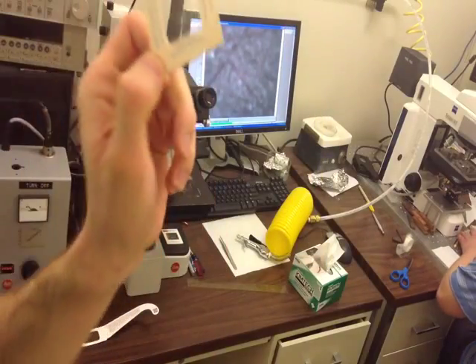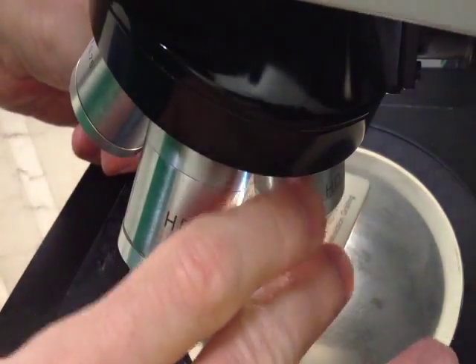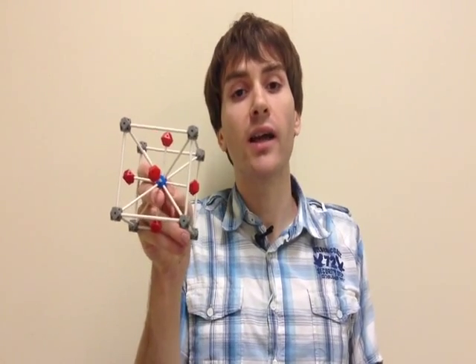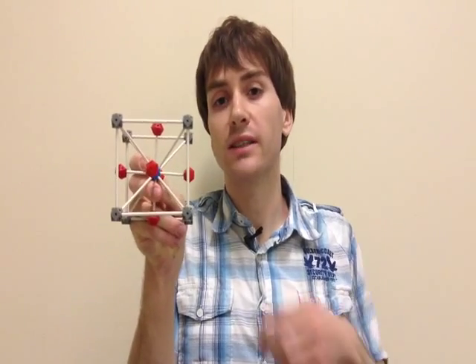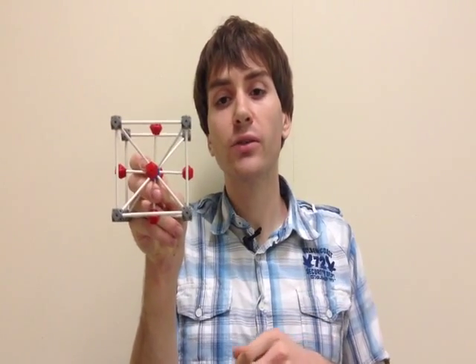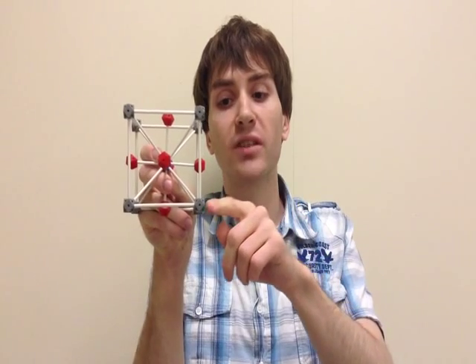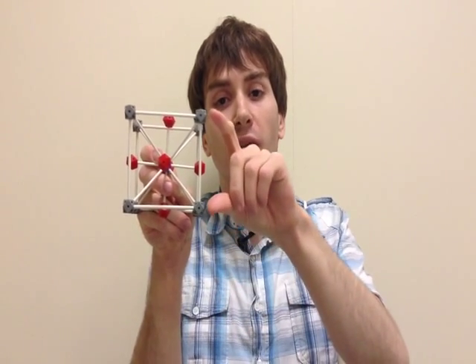We can now look at the grating using a microscope, and you can barely see the slightly darker areas which are the grating lines. Now we want to look at how atoms are arranged in a material. Many of them build small repeating units, and if they do, we can measure the distance between atoms using diffraction, just like we use diffraction for our grating.